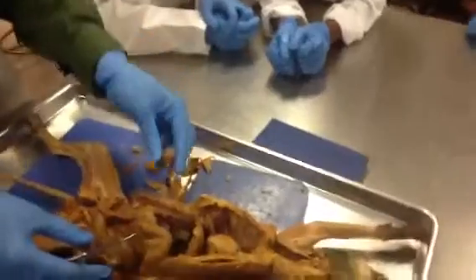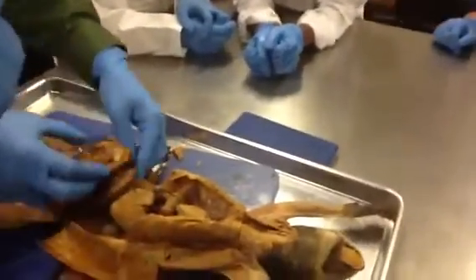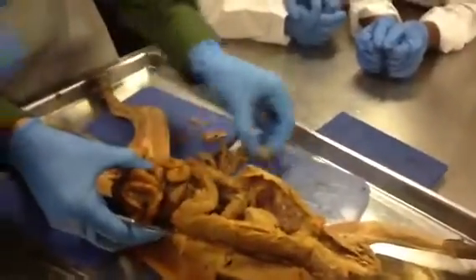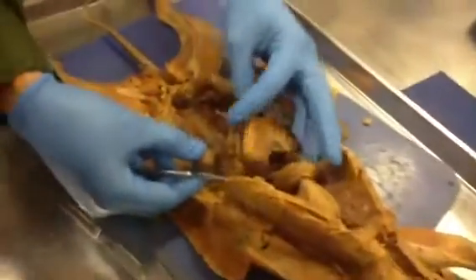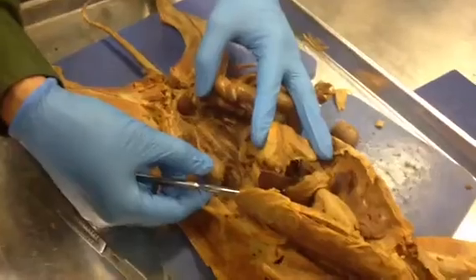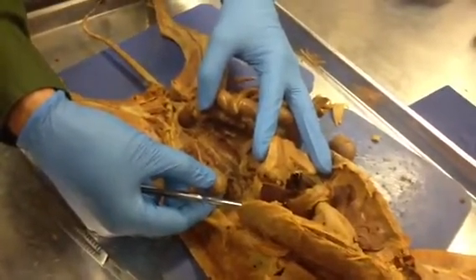Urinary system. Here we have a kidney which got dislocated. So we'll look at the kidney that is inside. When you identify this, I ask you, this is a kidney. What do you say? Left.